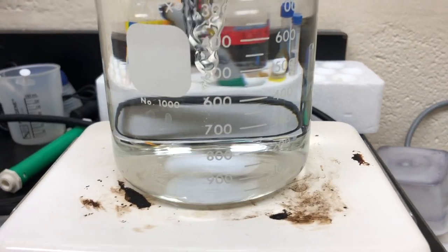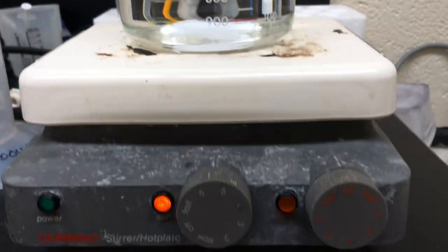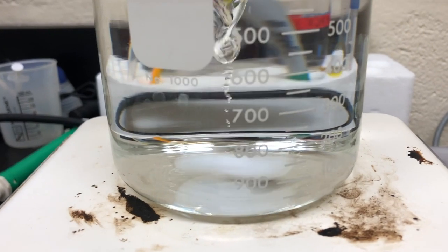So as you can see, the vortex doesn't reach all the way to the bottom. So what you want to do if that happens is increase the speed until it reaches the bottom, but very slowly.